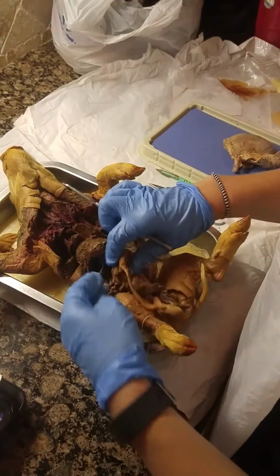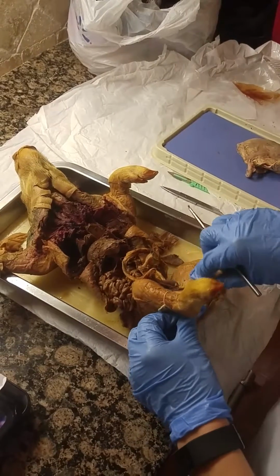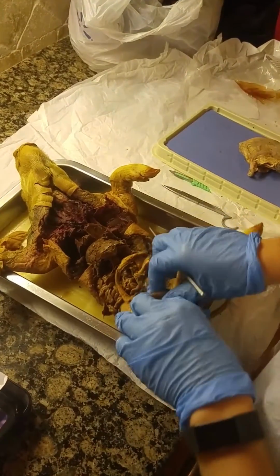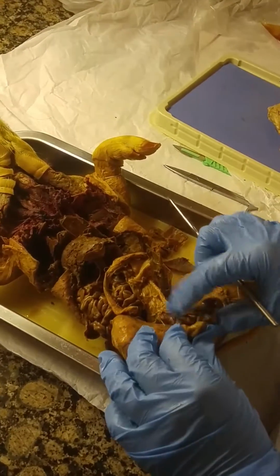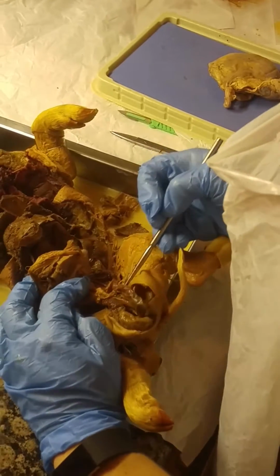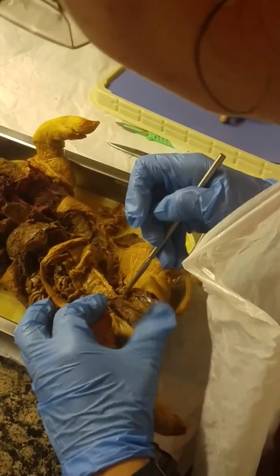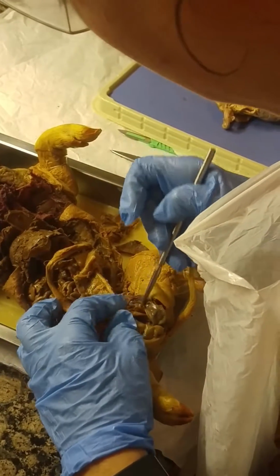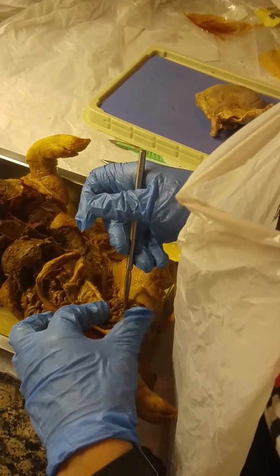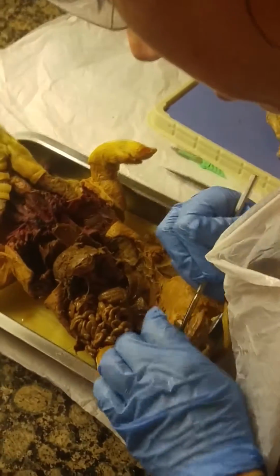This is a male pig. The scrotum, before I cut him open, was the outer sac holding the testicles. The testicles are these two figures here. The spermatic cord connects the testicles and runs posterior, and this coil-like figure here, also posterior to the testicles, is the epididymis.